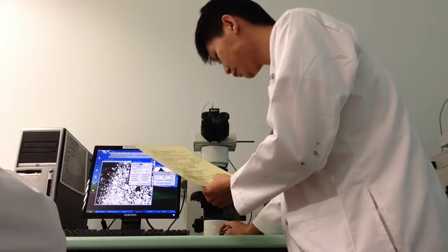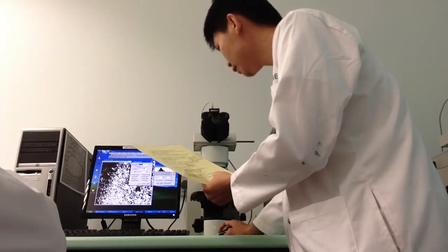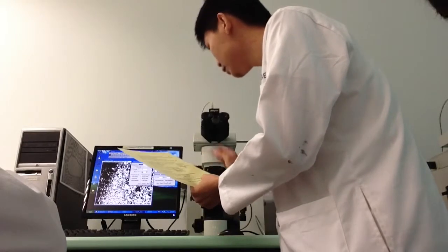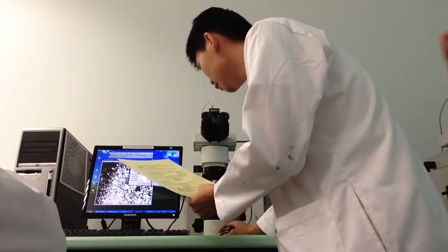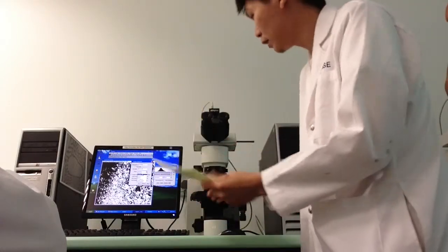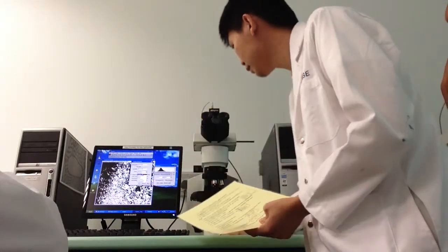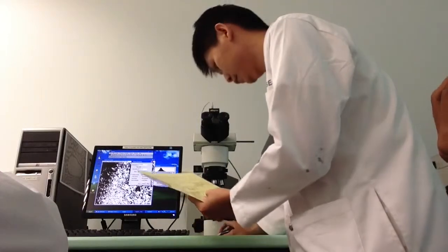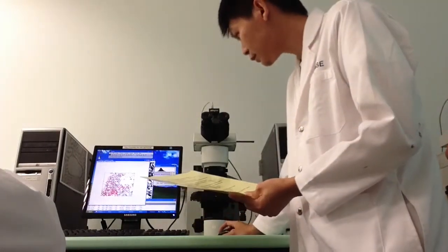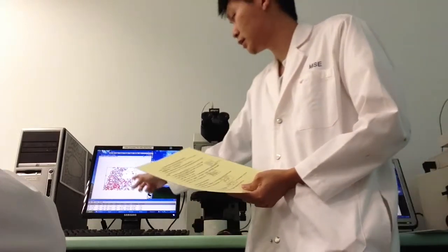So, and then you choose outlines. Okay, under show is outlines. Okay, and then you click OK. So you should see something like this.